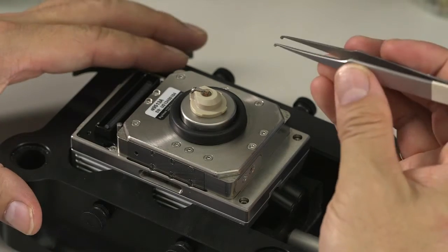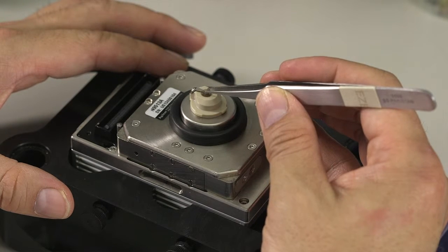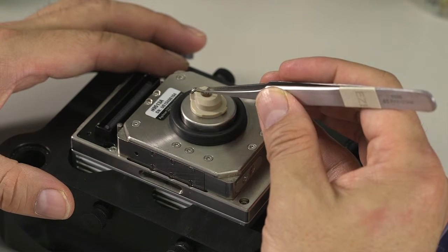Then, if you want to make sure, you could grab the cantilever with your tweezers and gently shake it a little bit. It should be solid and not shakeable.